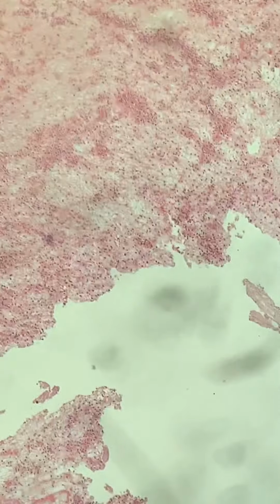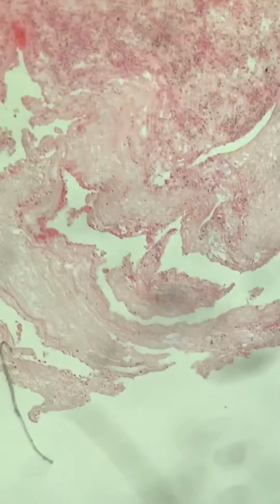We're going to find it. Okay, this may have been just all thrombus. I was trying to take it in relationship to its attachment to the muscle, but this was all thrombus here.